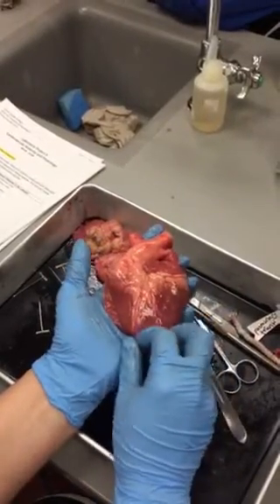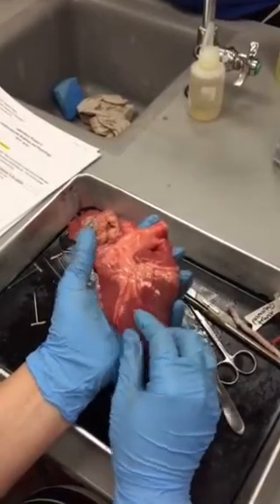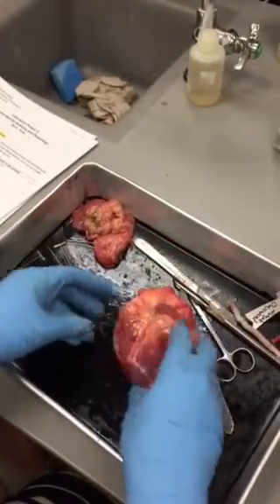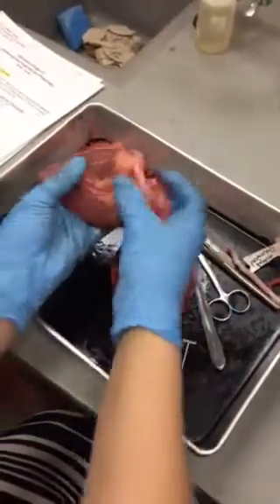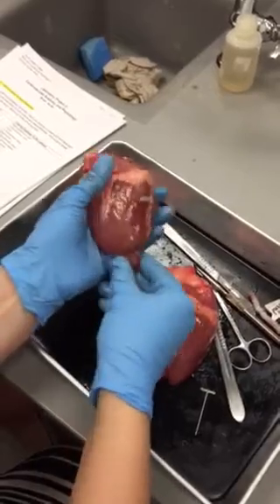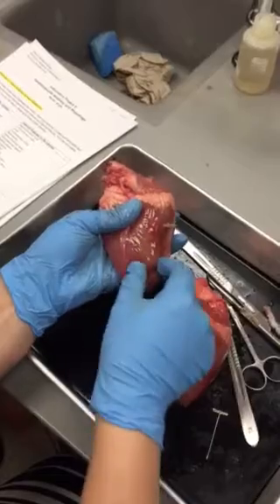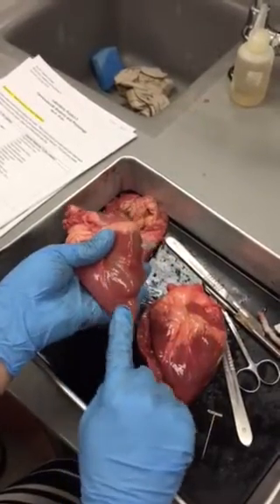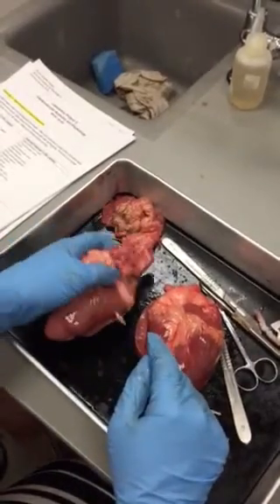Not all of them are going to look perfectly like this. Can you bring me your dissection, Hannah, or that dissection? Okay, so some of them are not this obvious with the apex. Oh, there's the pen in there. Yeah, some of them are a little bit harder to tell. Like you have just this little line right here. This almost looks like it could be going to the corner, but this is still the apex, so this is the left side. Okay, I'm just going to leave it here for now.